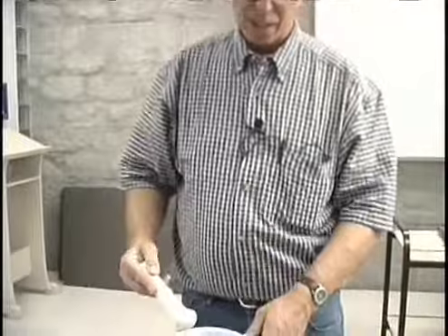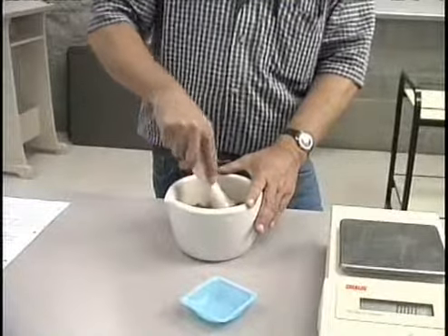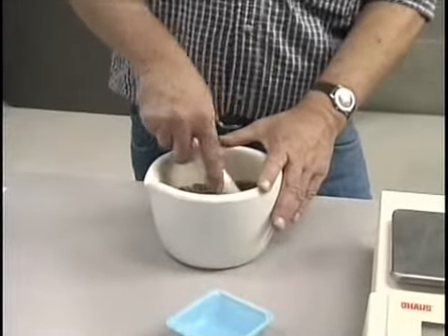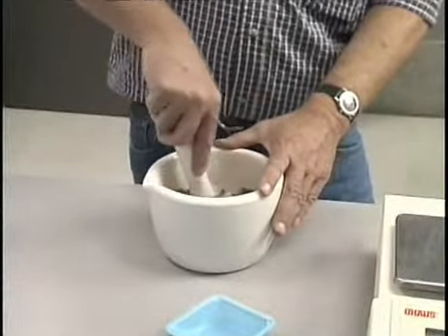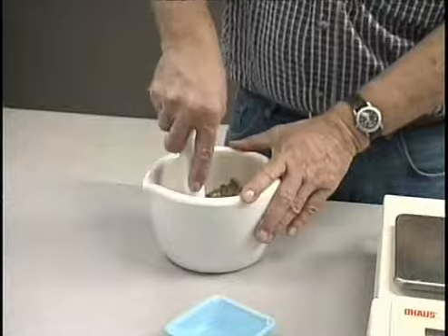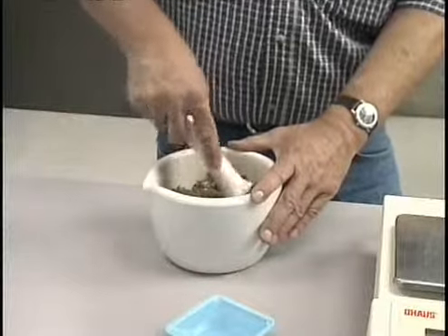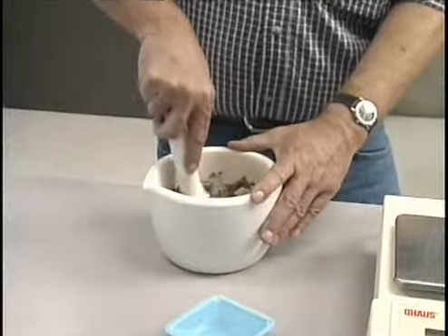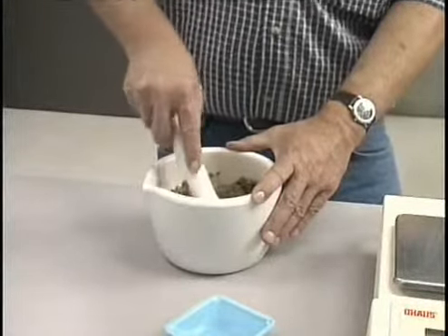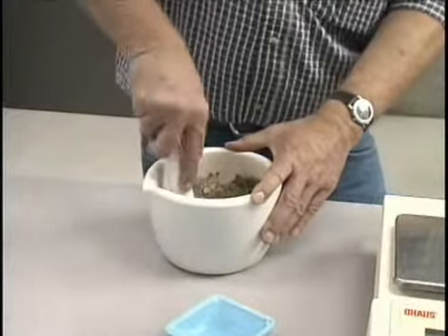The reason that we're going to remove these clods or aggregates is because we need to get this soil broken down into a single grain nature so that the individual particles will separate or settle independently of each other. To also assist us in this process, once we've got this soil sample broken down and weighed out, will be the use of a dispersing agent. This dispersing agent, which is called sodium hexametaphosphate, is designed to allow these soil particles to not want to be attracted to each other, but rather to separate independently of each other.